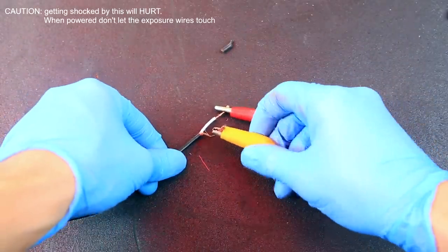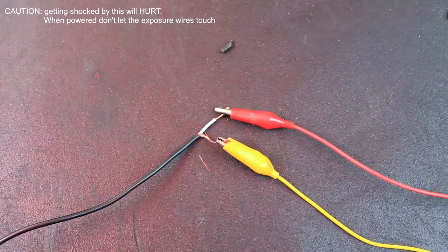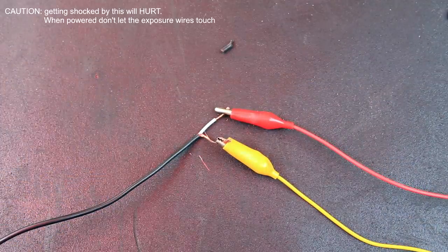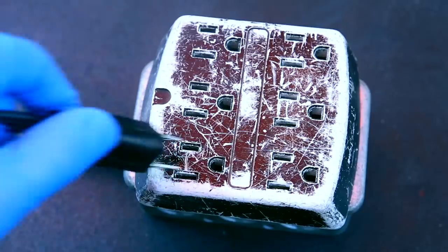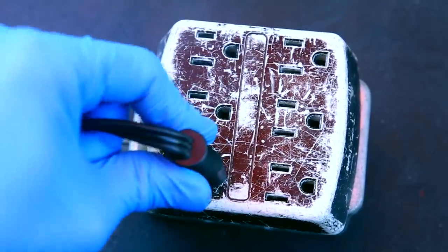In general the wrapped wire is positive, but depending on the polarity of your adapter it could be negative. In the end it doesn't really matter because it doesn't really matter which side the crystals grow from. And then to get things going we plug it in.